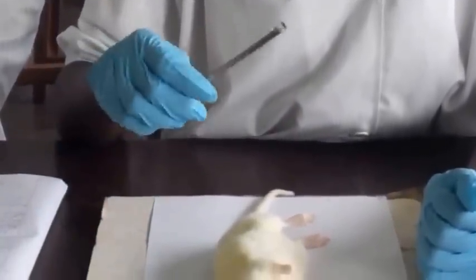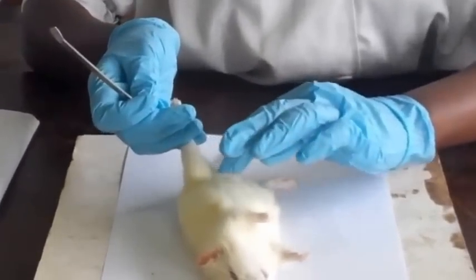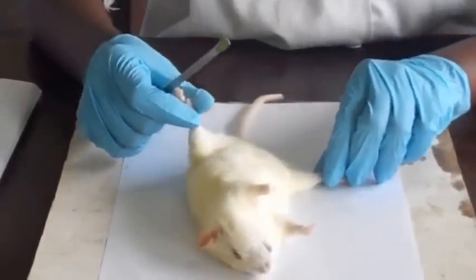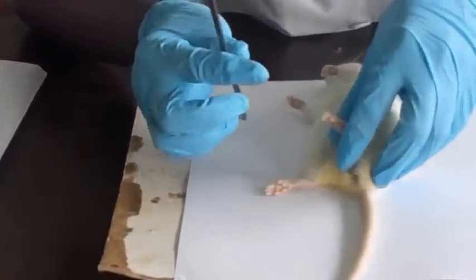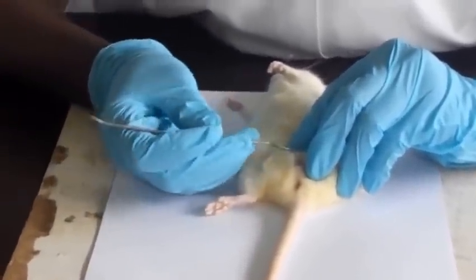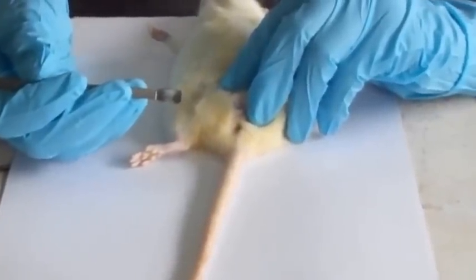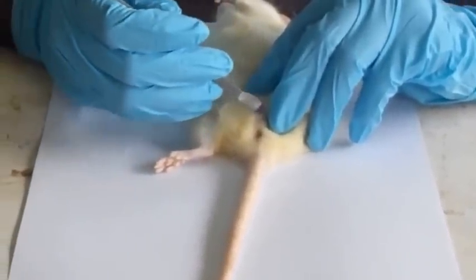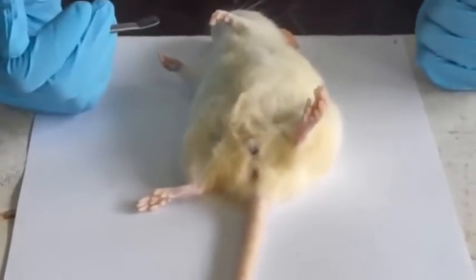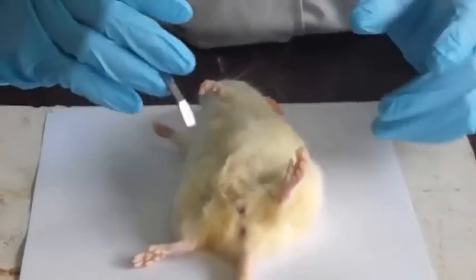As I said before, this particular one is a female because it has the nipples, which signify presence of mammary glands within. Then it has the clitoris, right down here. It has an opening. And then it has the vulva, which is this opening you can see here. In case it were a male, we would see the penis enclosed in a sheath of skin and a pair of scrotal sacs.